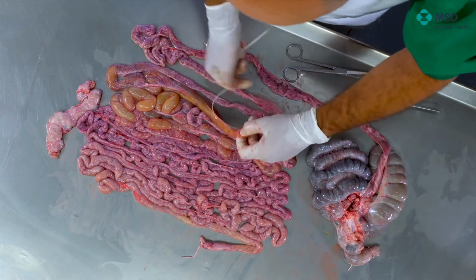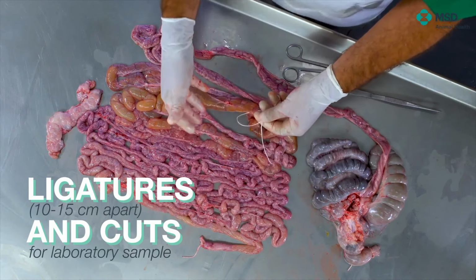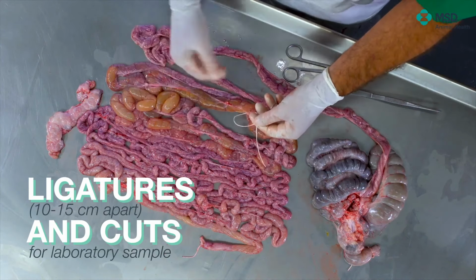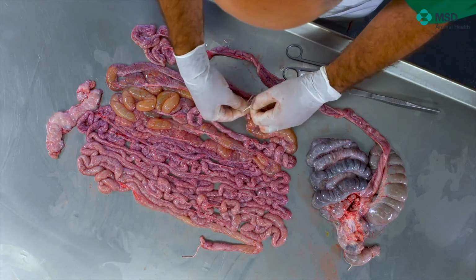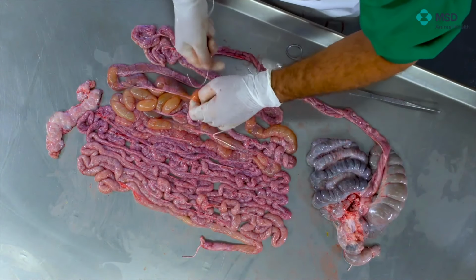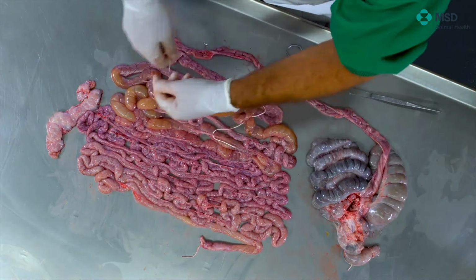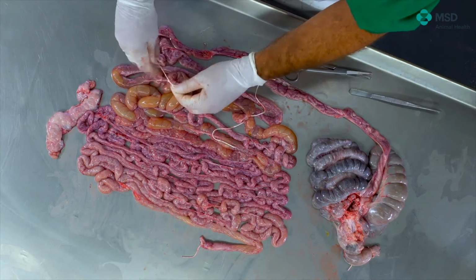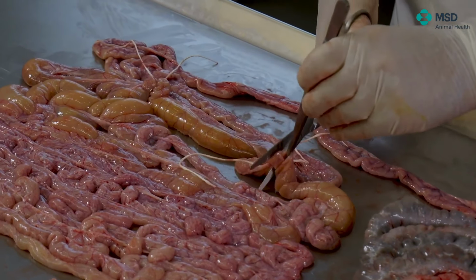How can we do that? The easiest way is take the part of the intestine that we want to submit. In our case, we prefer jejunum towards the ileum. Sometimes we can take ileum as well. And we are doing a knot on one side, and we are doing the knot in the other side. By doing this the sample will not be further contaminated, I mean, and it will be excellent for taking it out.